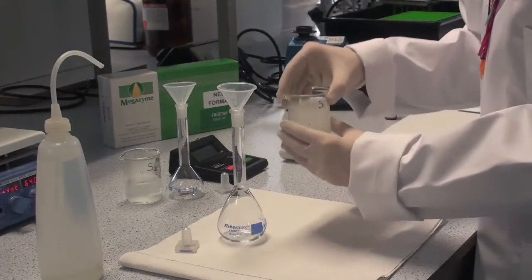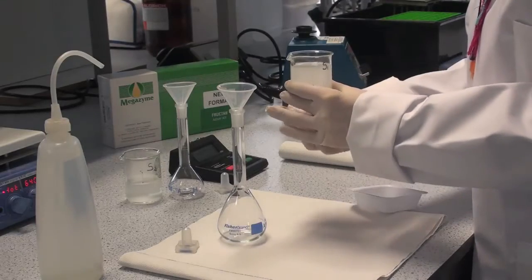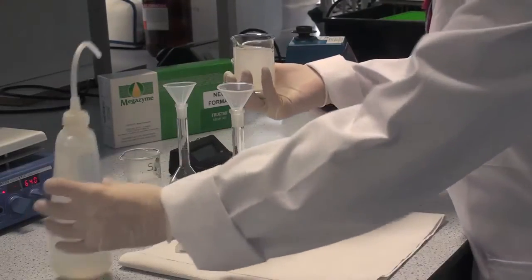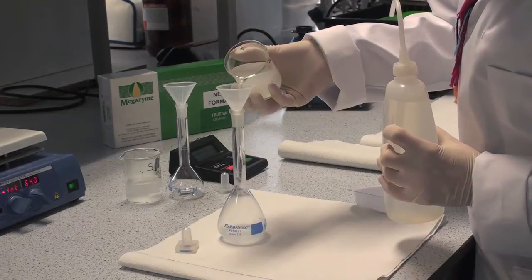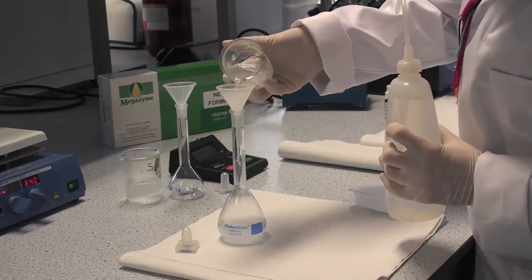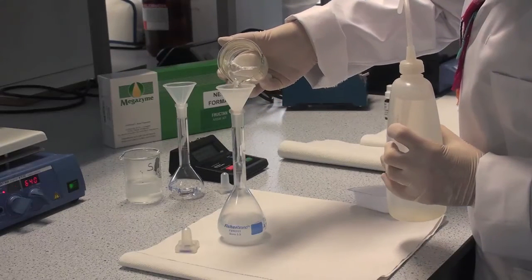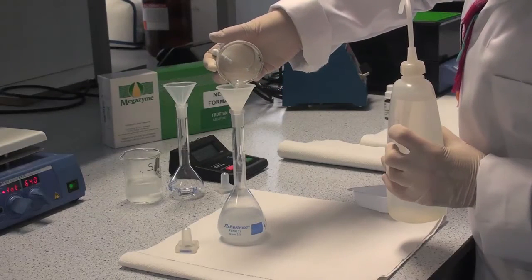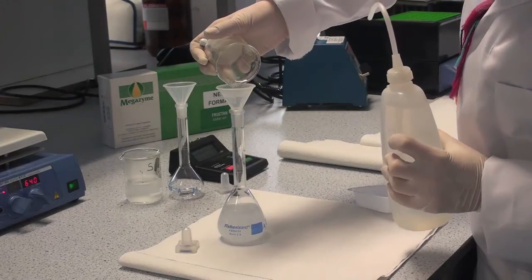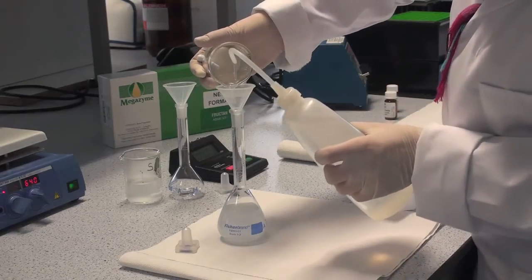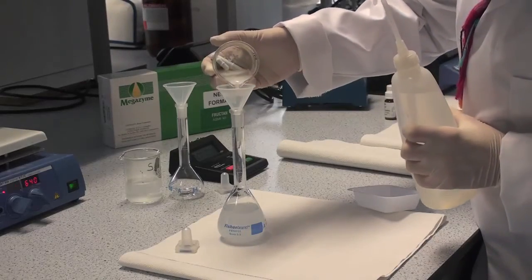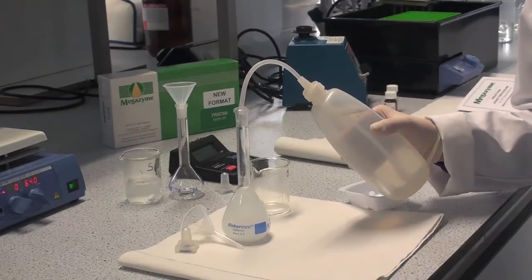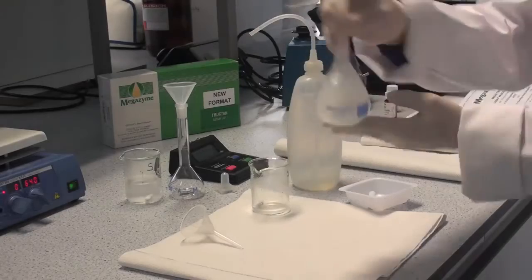Allow the solution to cool to room temperature and then quantitatively transfer it to a 100 ml volumetric flask. Use a water wash bottle to wash the remainder of the sample into the flask. Mix the contents thoroughly.